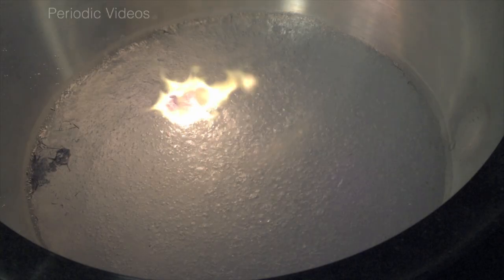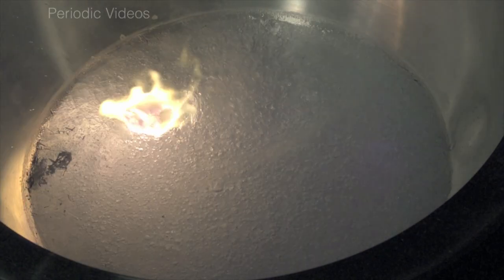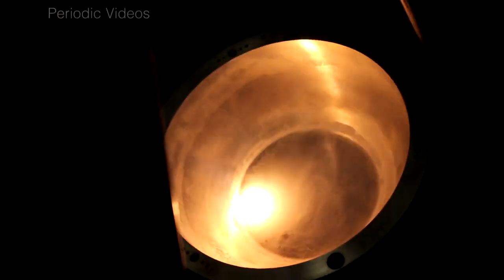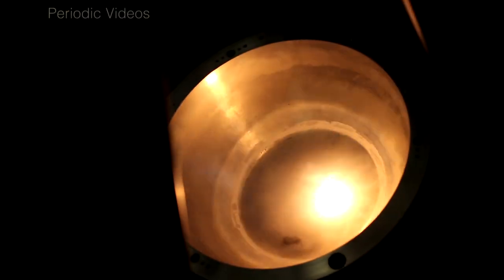So the charcoal is surrounded by a cushion of air, except it's round, so it's more like a bubble. And that's important because, of course, the oxygen gas gets much more efficiently to the surface to maintain the burning.